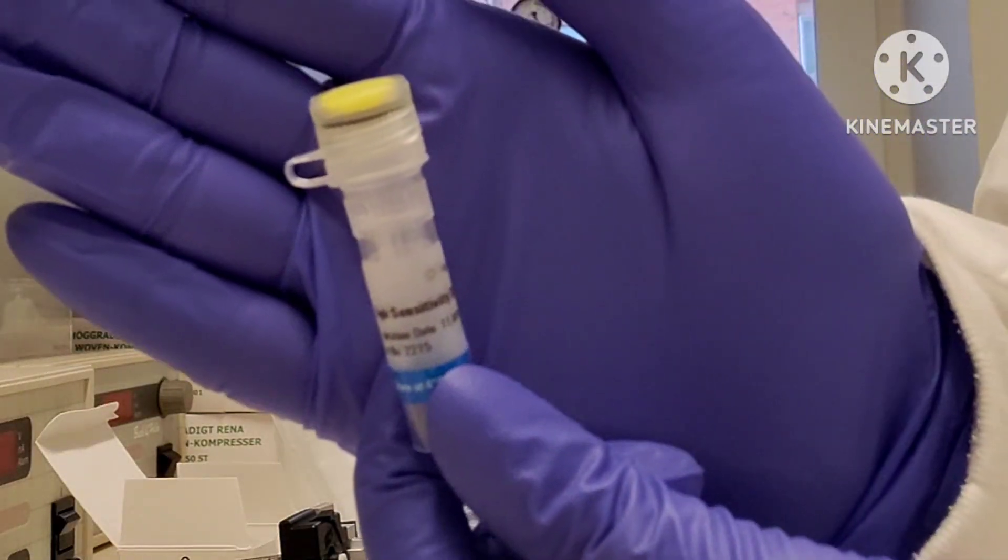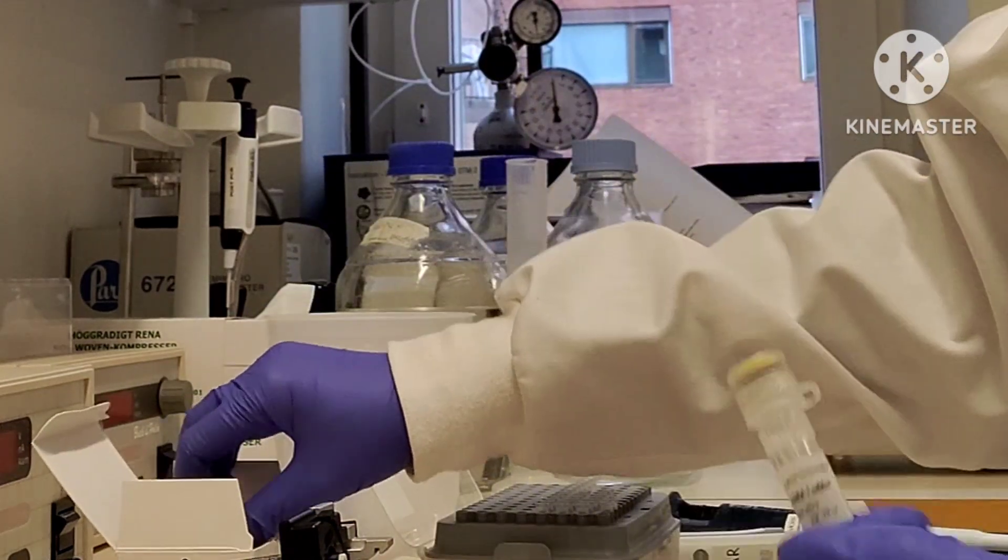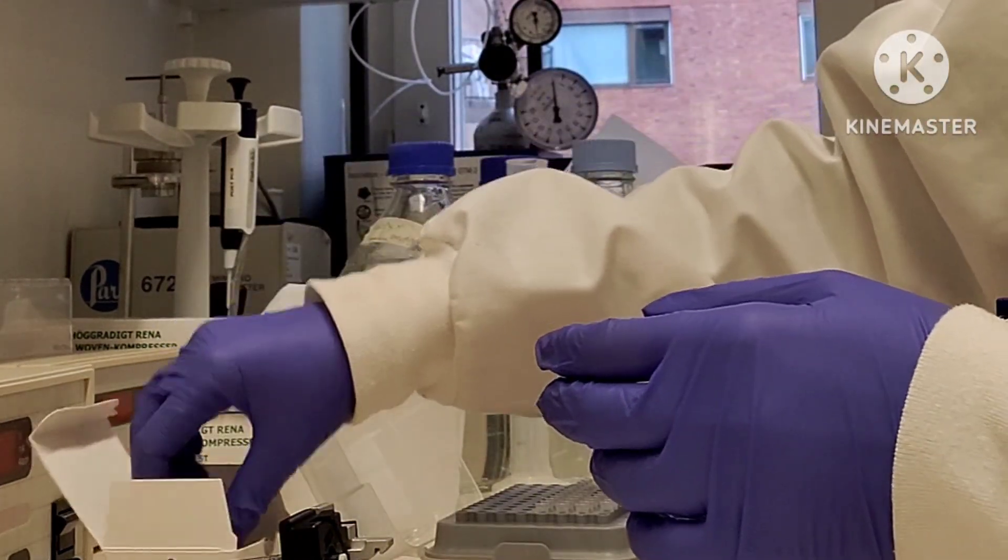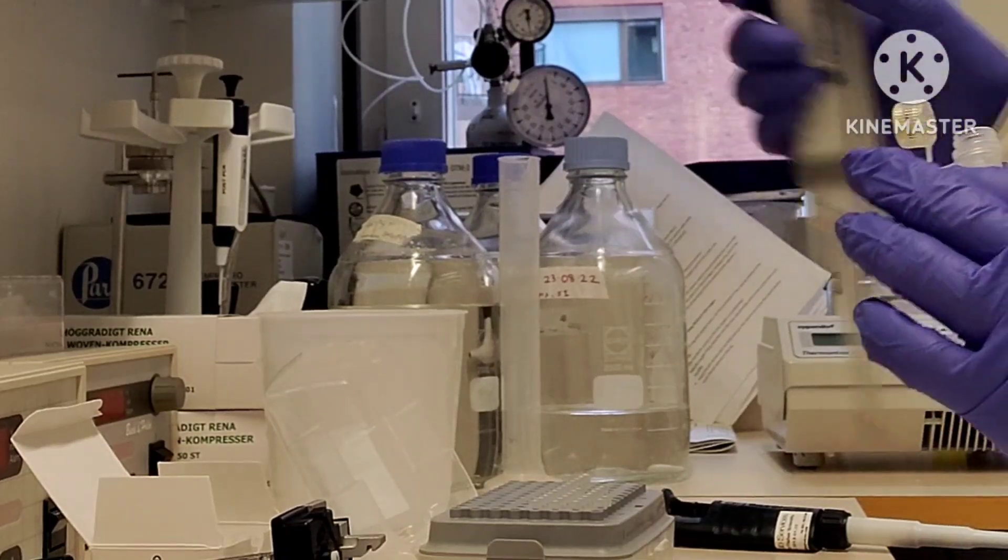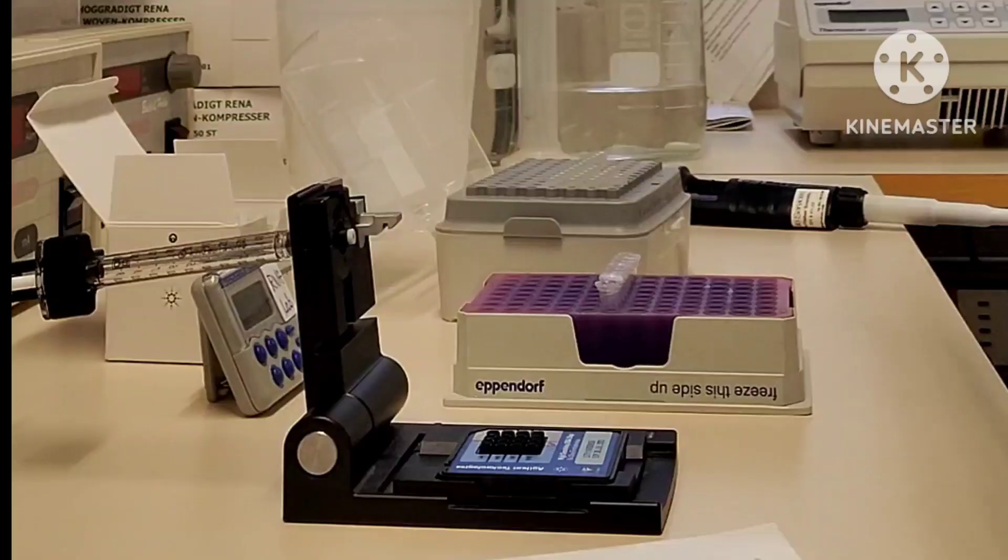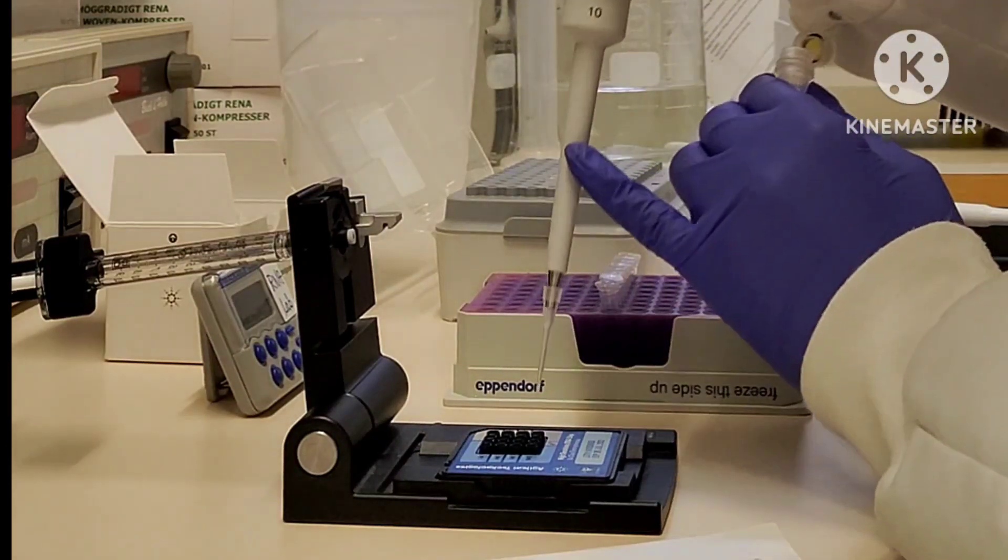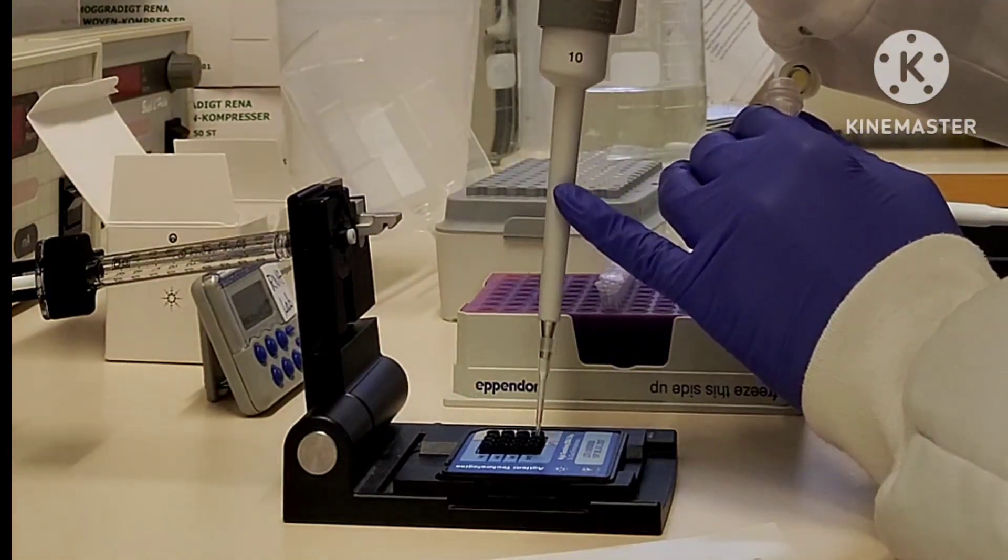This is the ladder. You can add one microliter of ladder in the well which is labeled as ladder. One thing I forgot to tell you: before adding any reagent, just vortex them a little bit.